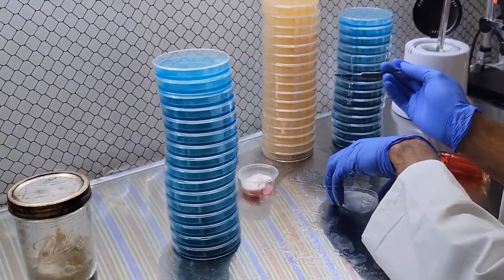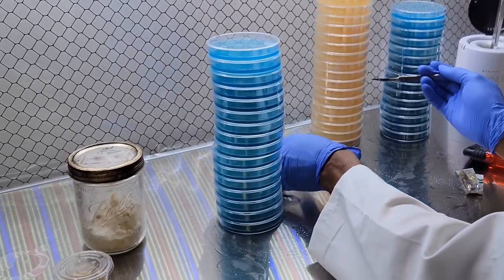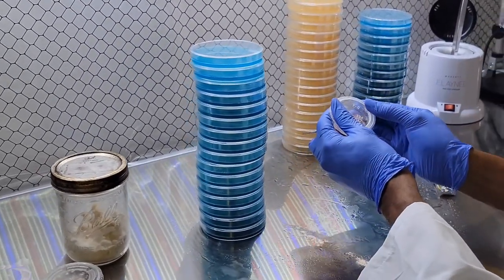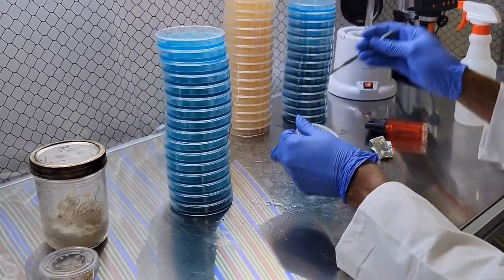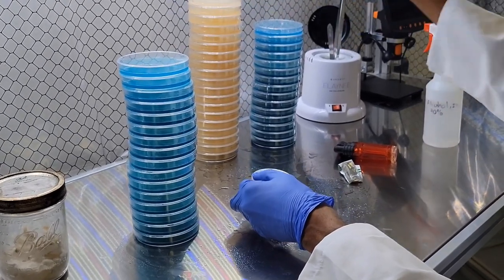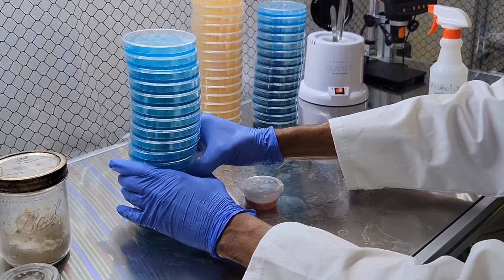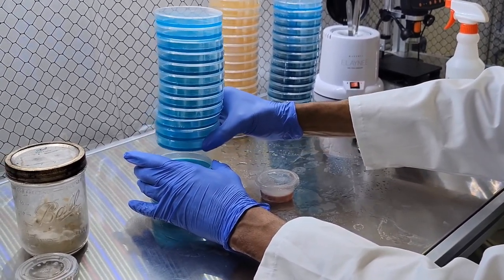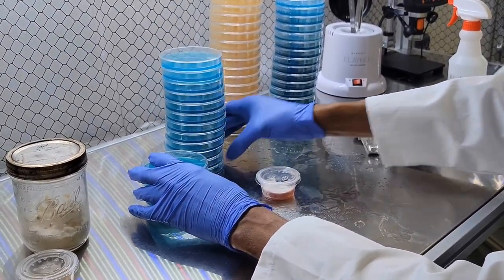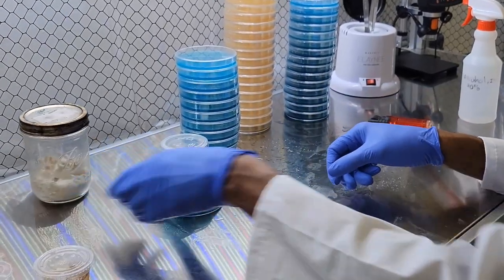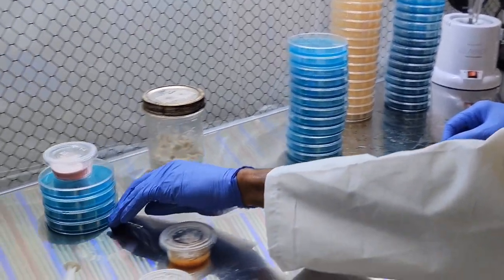It's going to take help—it's going to take a lot of the chitin. So what I like to do right after is I'll take the plates that I just made, take the plate associated with it and I'll put it off to the side, not be on top.